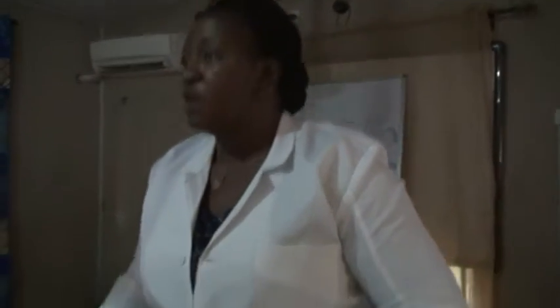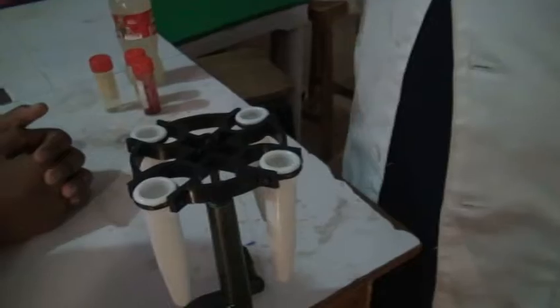The centrifuges are of different types. We have the machine-run one, like the ones you see in the hospital. They just plug it to electricity and it spins on its own. But this one is the manual. We are going to fix the hand, and by the time you turn it in one direction, it will spin. And after some time, the solid substance inside this will settle at the bottom. So can we start now? Are we ready? Yes. Let's go.